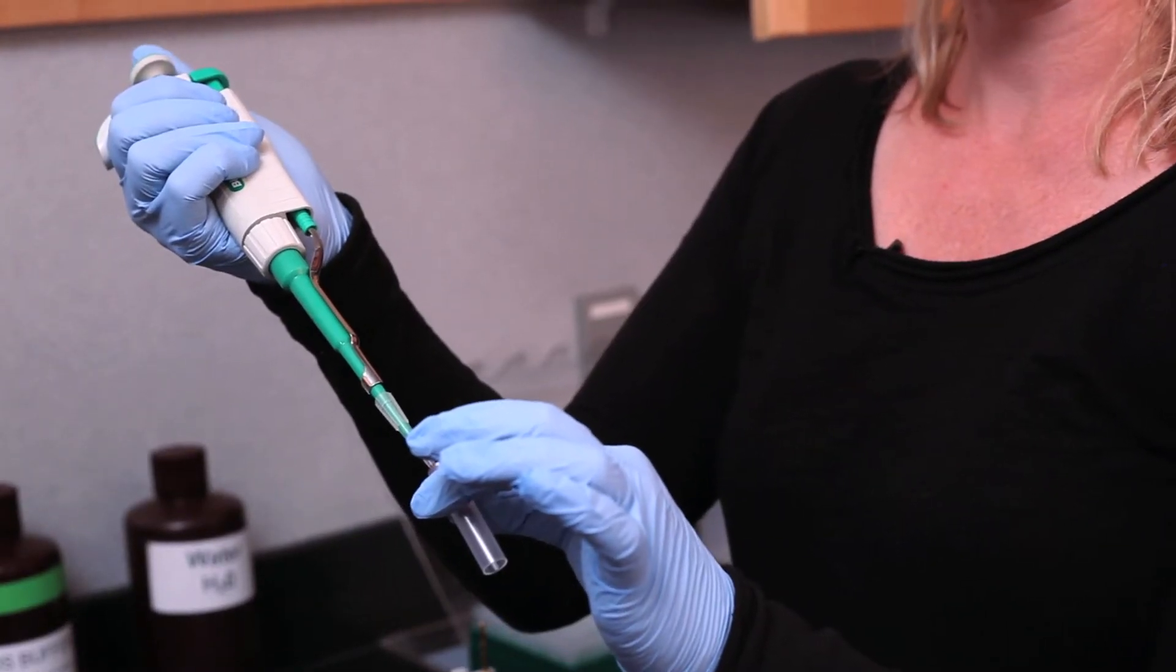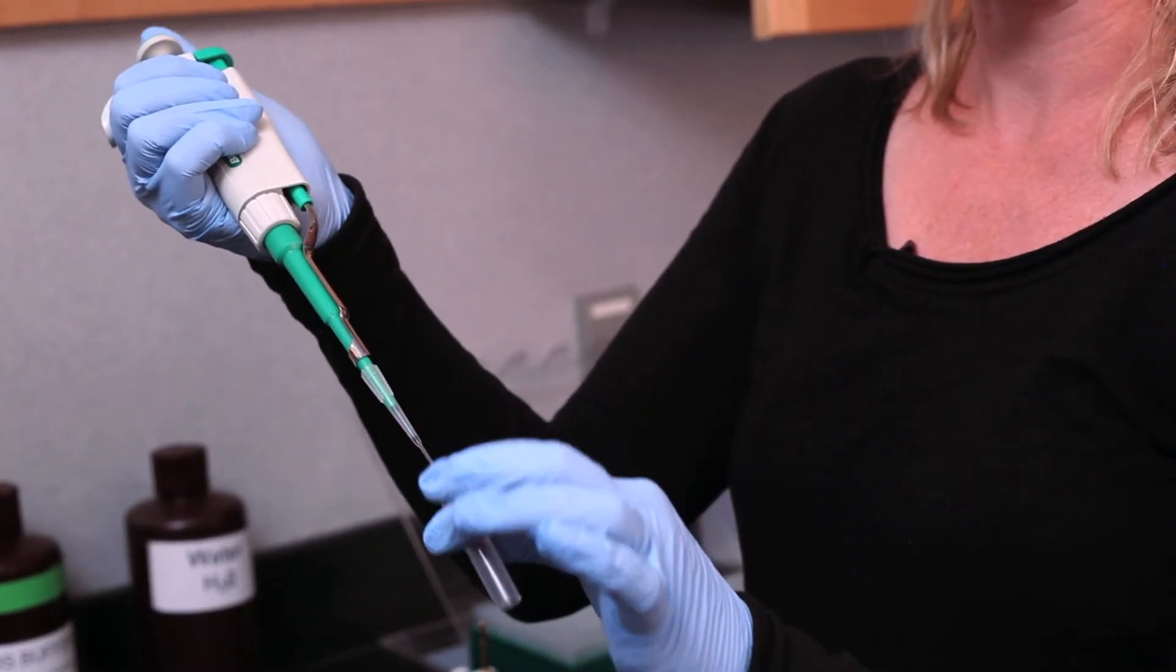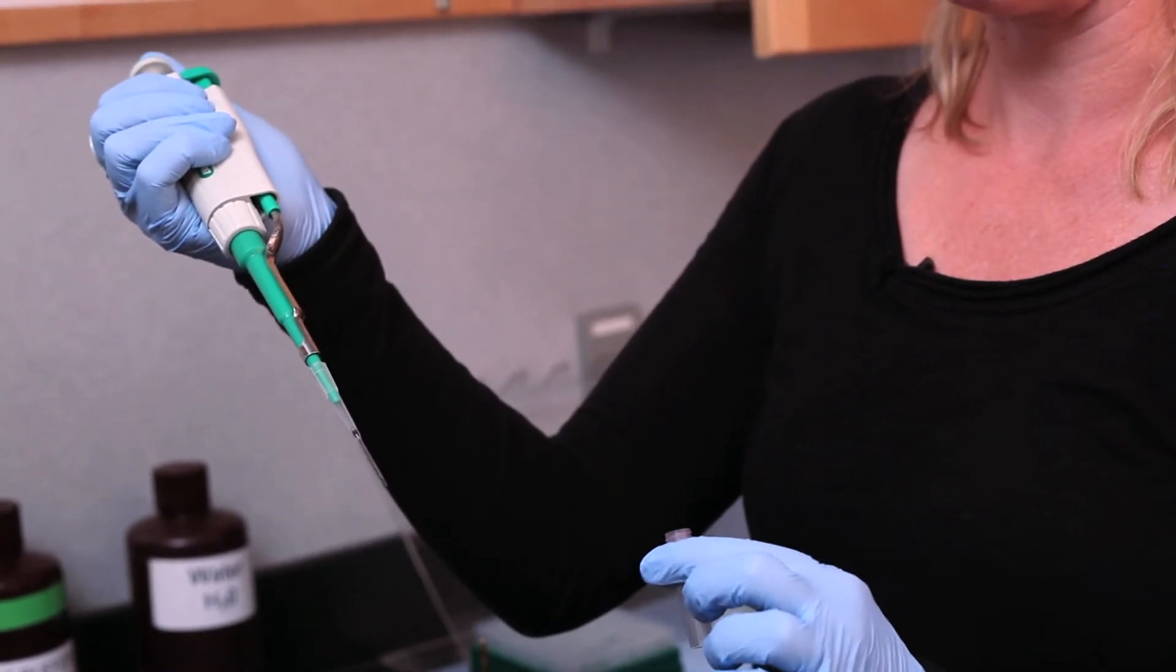And then once my sample is mixed, I'm going to withdraw 10 microliters of my sample to load onto my gel.